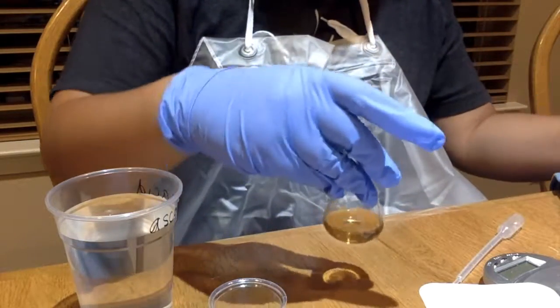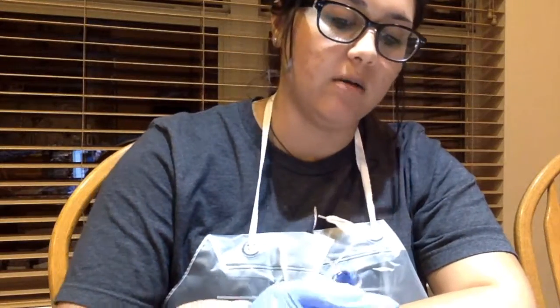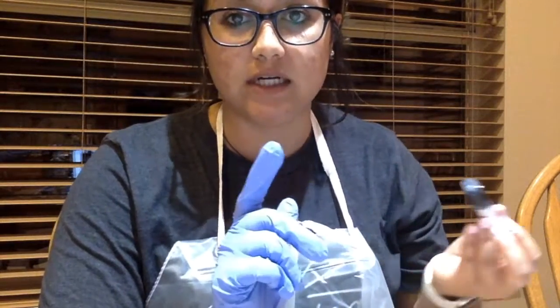Okay, so in the lab description, it said that it may create a yellow tint to begin with, but it needs to be a green or blue color by the end, and it never created that blue, but it has the green tint to it, so that will be my endpoint. It did take a lot from the syringe, but I will calculate the final volume I have on here on my data table.